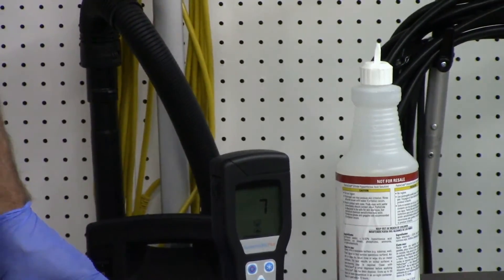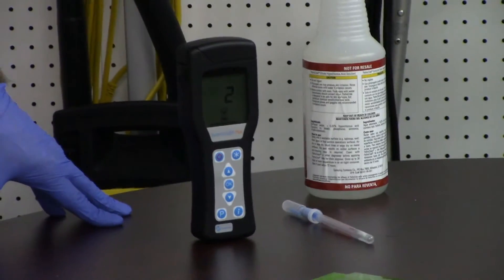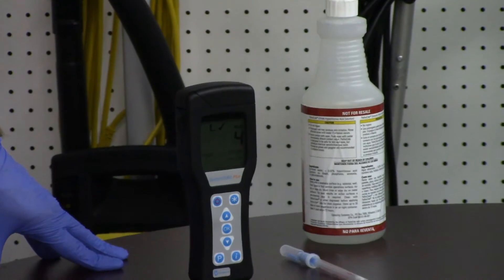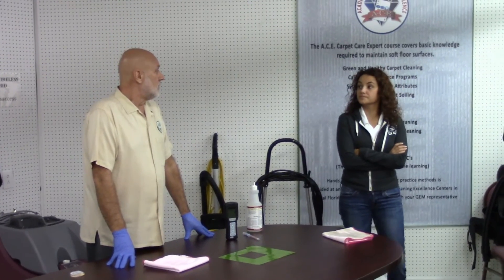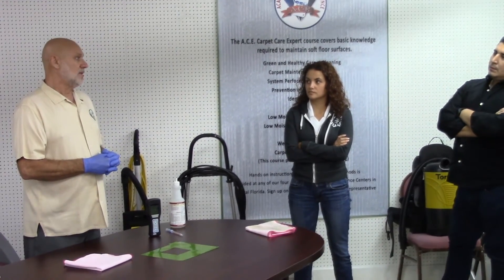Cleaning is removal. The thing is, here I may have cleaned and I may have disinfected — I don't know, I can't see it. What does the meter say now? Four. On this manufacturer's chart, anything below 10 means I can prepare food on this surface safely.